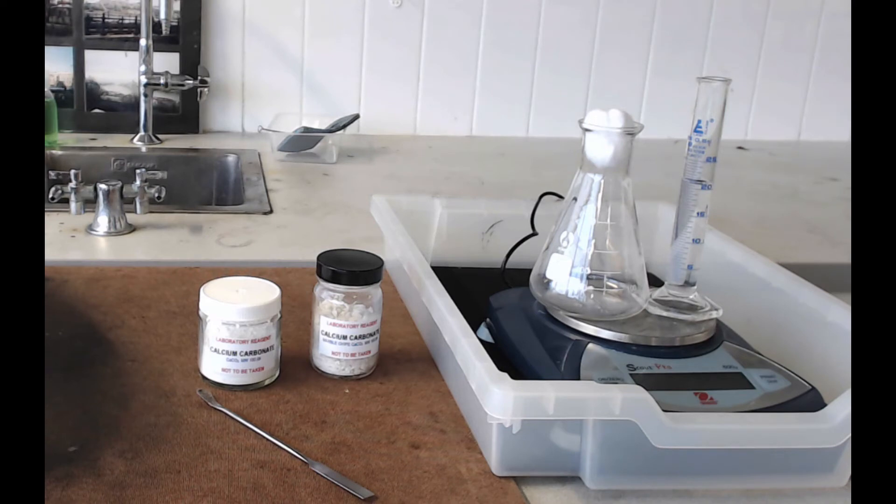The reaction is going to happen on the balance, and you want to monitor the mass that is lost from it. It's important that you know this mass reading right now. We're not going to record the mass that remains, but rather see how much mass is lost from the reaction.